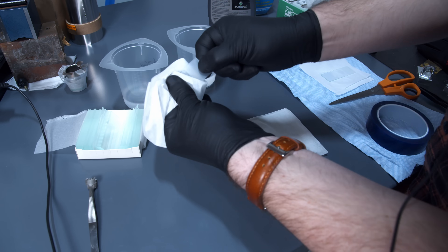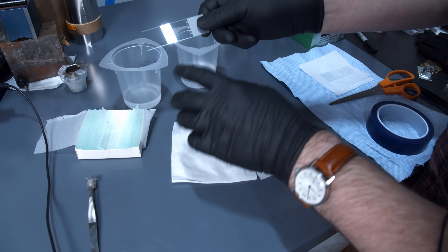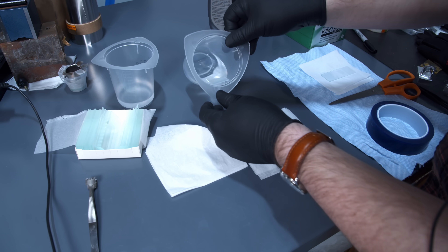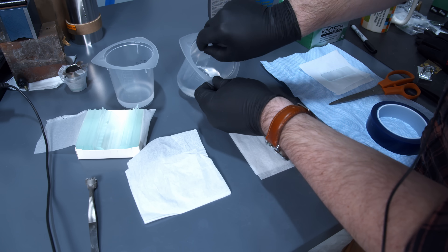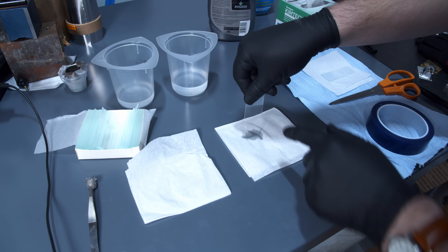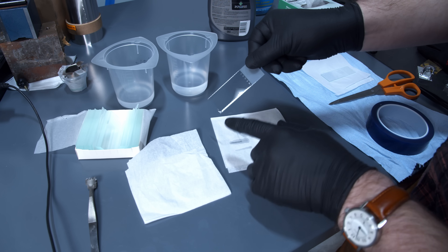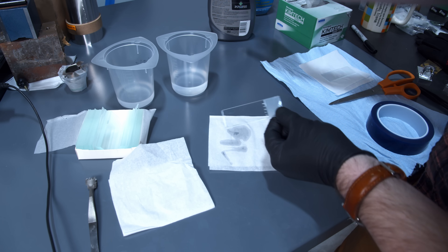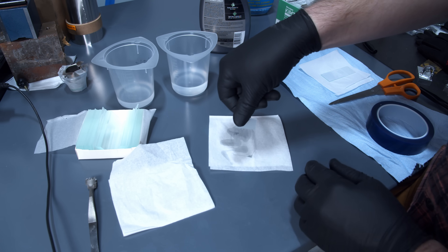This is usually sufficient — just give it a quick wipe with a Kimwipe, something lint free. In my experience, this gets basically all the coating off. But there will be a little bit of acetone residue, so we're going to throw it back in the acetone, give it a swirl, and then dunk it in 99% isopropyl. The point is just to get rid of that acetone residue, as isopropyl leaves less residue. If this was a microfab experiment where we really cared about adhesive properties, the next step would be rinsing with distilled water and drying with compressed air or nitrogen. But I'm not going to worry about it because this spray includes isopropyl alcohol, so any residue left on here will just get dissolved in the solvent of the spray itself.